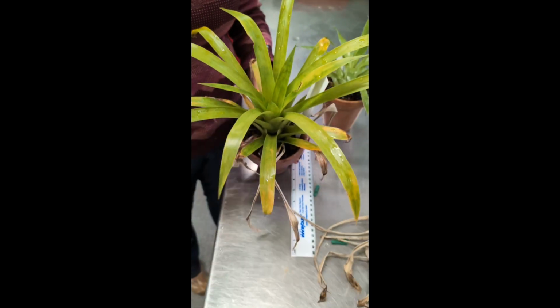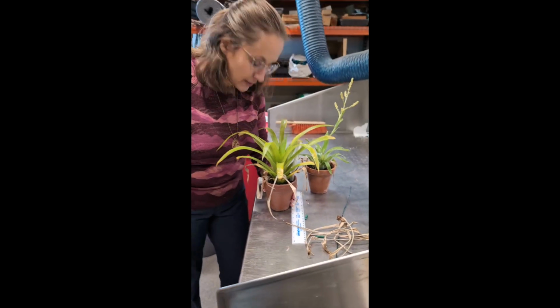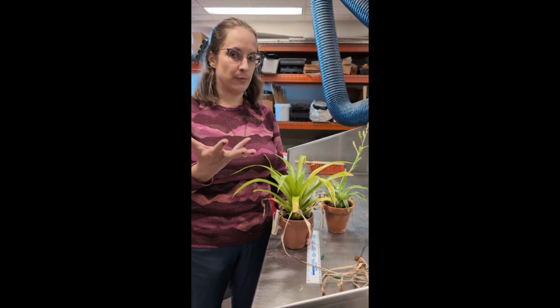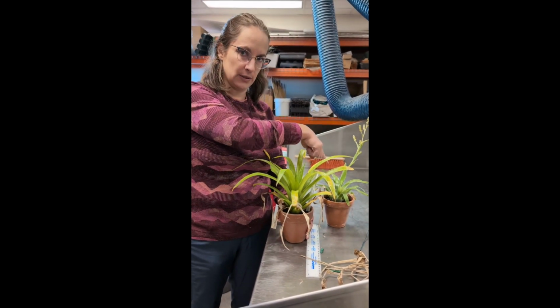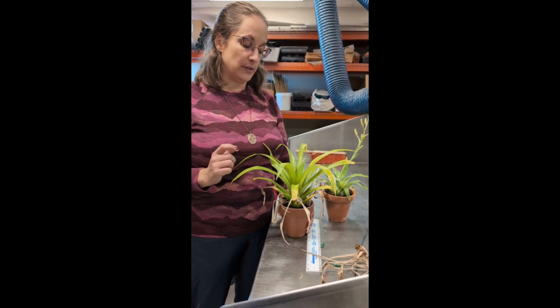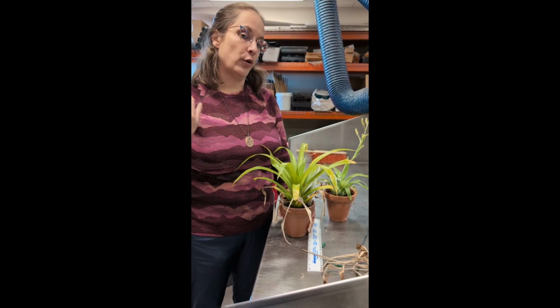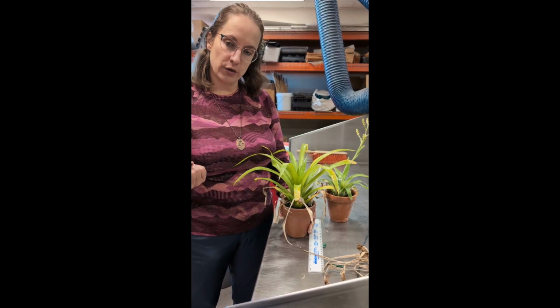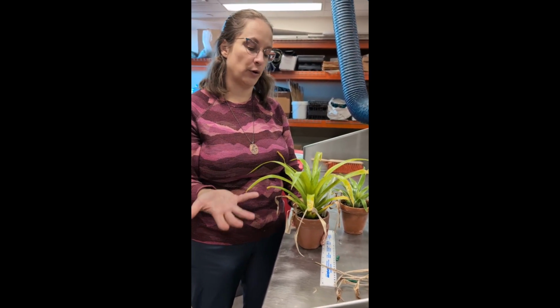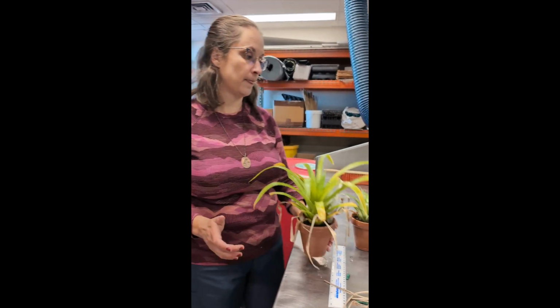And I don't need to stress too much about really looking down in there because I can tell you from personal experience, it's very dramatic and fast when it starts to build an inflorescence. So this individual, I would say, is vegetative growth only. I might write down those words, or I might say the category 0 vegetative growth only for this individual.